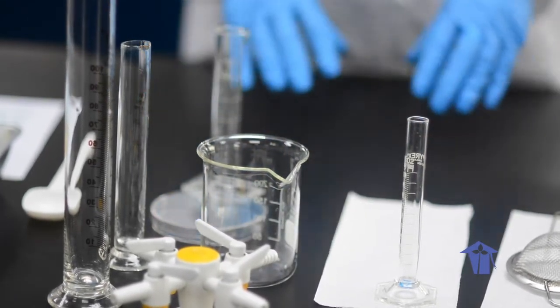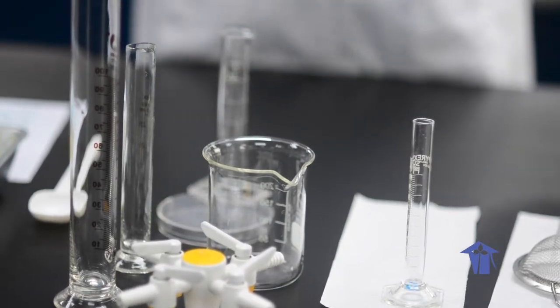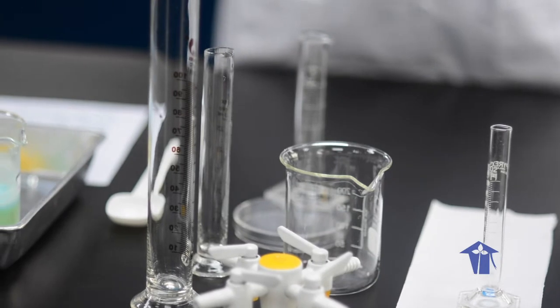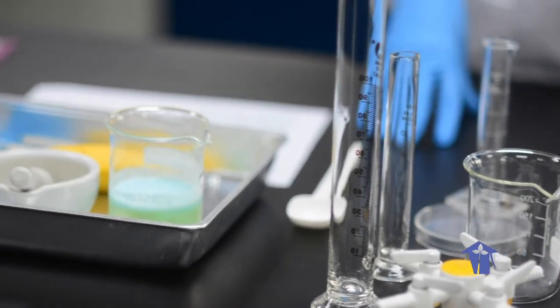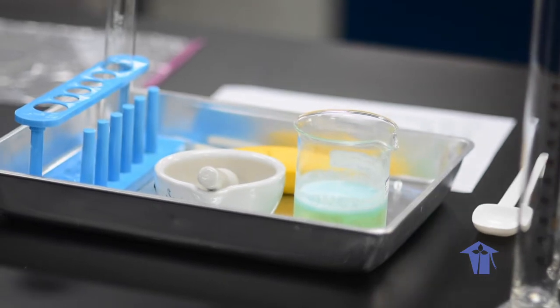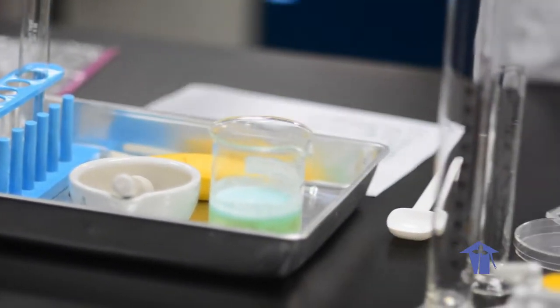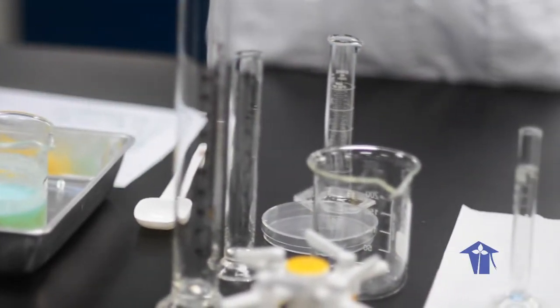Make sure the area in which you set up is far away from any heat sources such as your stove or candle or anything like that. Set up all of your apparatus and materials in a logical manner on a clean, flat surface.